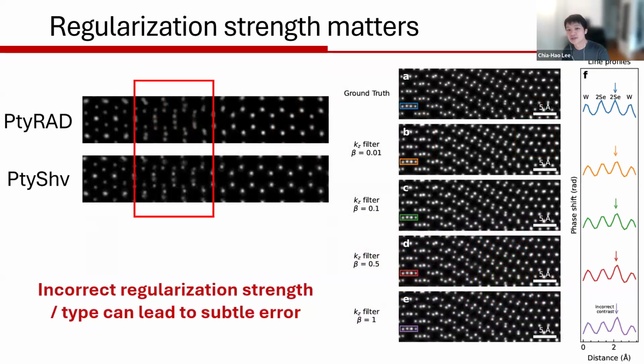And this is another subtle example of the regularization strength that I recently figured out, maybe a couple months ago. When I was using ptychoshelves with the KZ regularization, I was getting this incorrect contrast between the layers. If you're familiar with 2D materials, you will know that they form hexagon shapes. And this is a twisted bilayer 2D material. In this ptychoshelves reconstruction, you can actually see that it misreconstructed the whole thing by having one hexagon look brighter than the other one. That is just not physical because we actually have a transition metal dichalcogenide. So having an incorrect regularization strength can mess up your atomic contrast in a very subtle way.